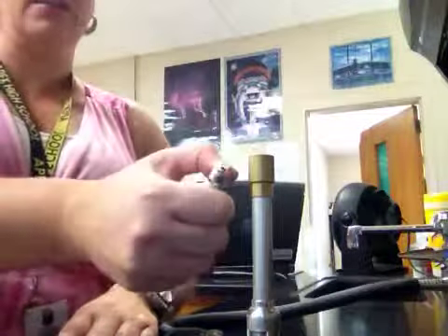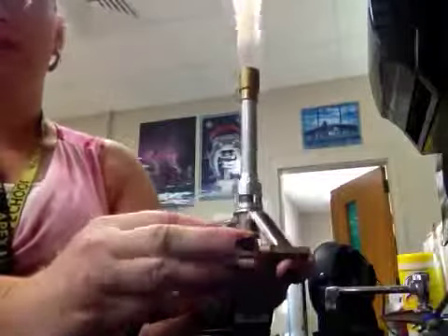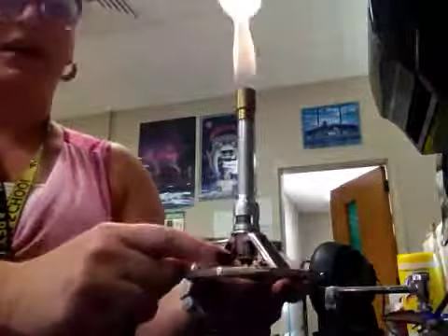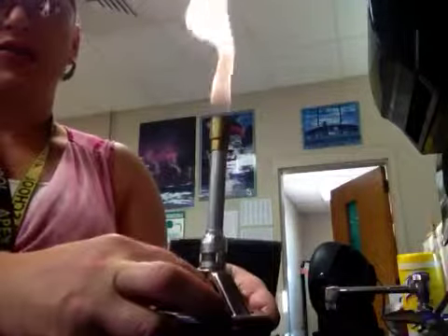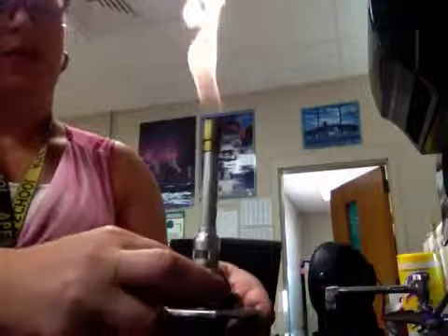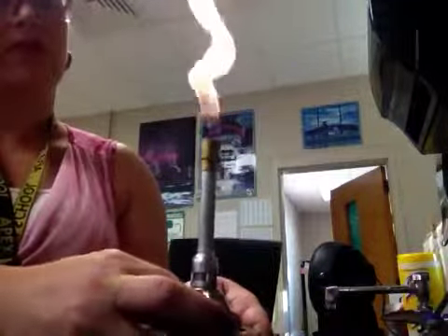Hold your lighter to the side, and gently pull it up until the flame alights. Now, this has a lot of red and orange in it, and that's not what I want. I want a blue flame. So the nozzle at the bottom here will adjust the amount of gas going in. I can change it, and my flame will get lower, so we can lower our flame a little bit.